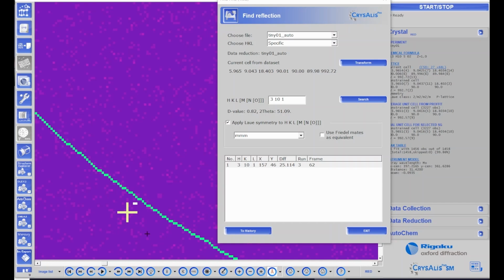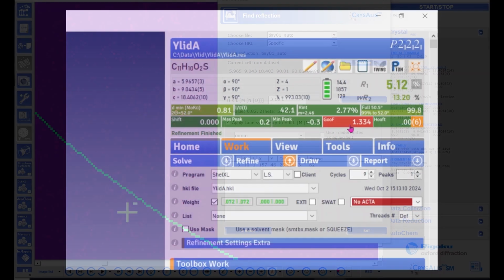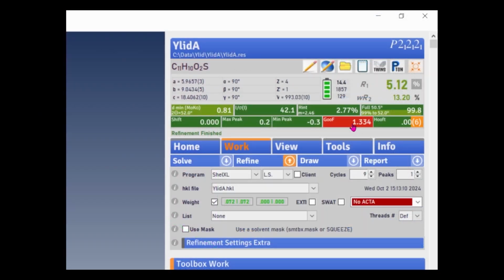So I need to mask those pixels so they're ignored by CrysAlisPro. You can search for the string hot pixels in the CrysAlisPro help file for more information about how to do that, or contact your CrysAlisPro service department. I've now masked those pixels in this data set, and I went back and reintegrated the data. So let's go back and look at the structure.